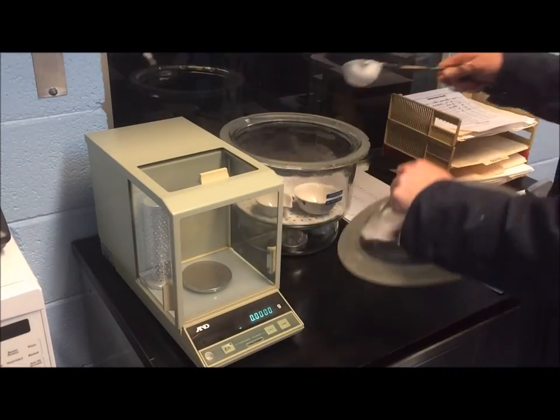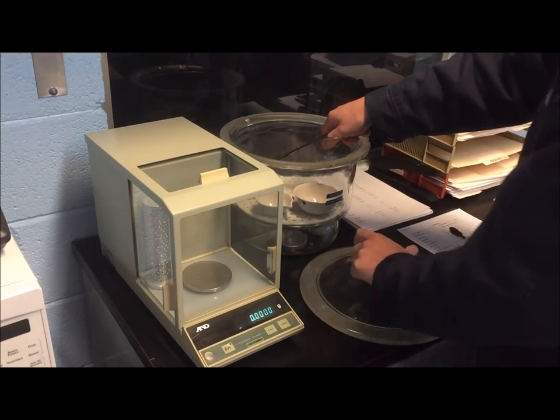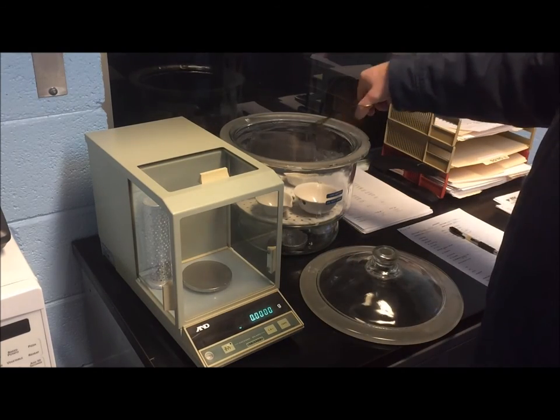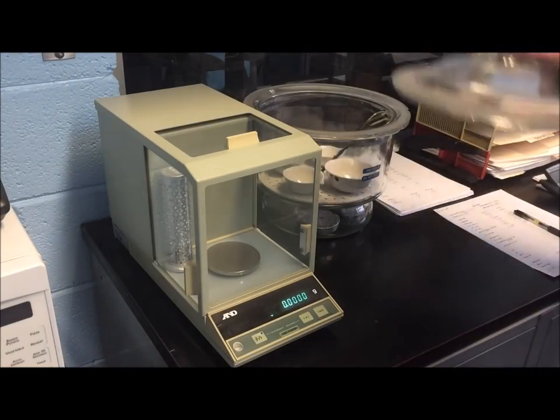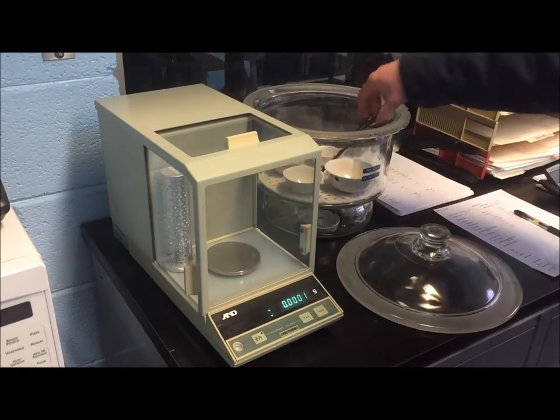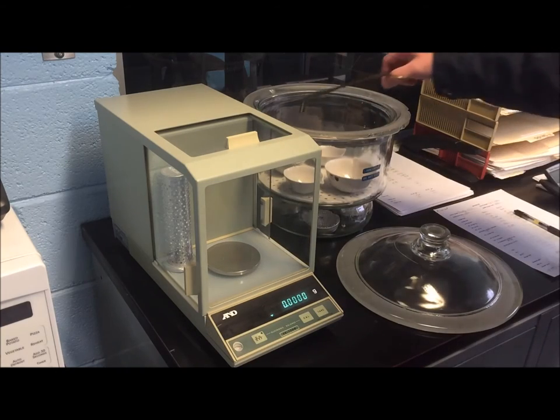Once again, the samples must be cooled in the desiccator so they don't absorb any moisture. Now the non-volatile portion of our samples can be weighed and recorded.